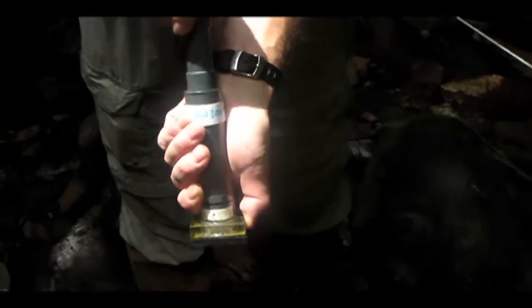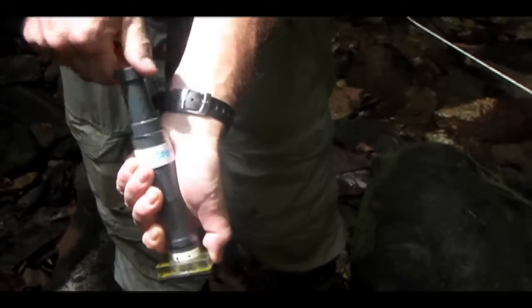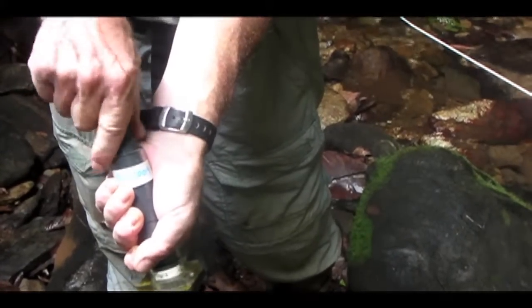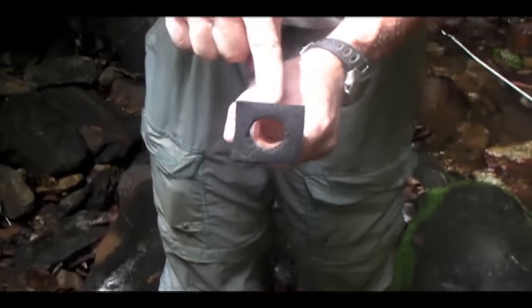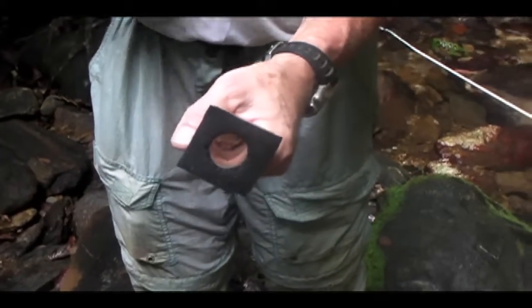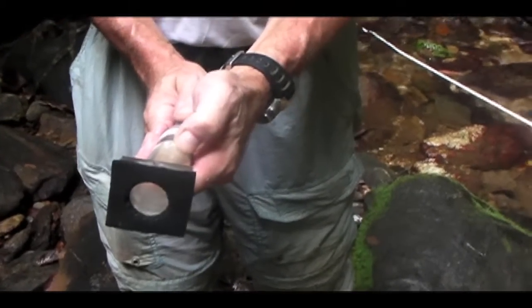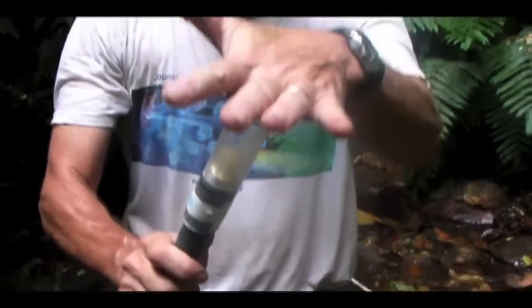And so what I'll do is I'll put my finger over the hole like this, and then I'll press it down on an environmental surface, crank the brush 5 times clockwise, 5 times anti-clockwise, take my finger off the hole, and pull up the plunger so that it fills with water. And so the water runs from the hole just into this surface, which means it's going to suck up everything that was scraped off of the environmental surface. And everything that was on the environmental surface will now be in this tube.